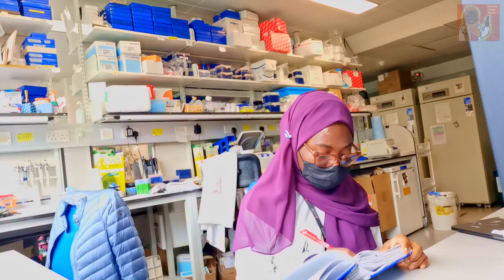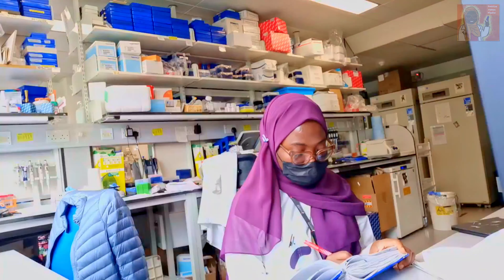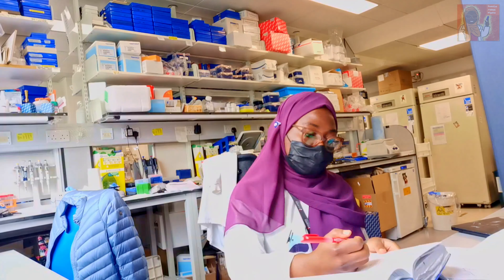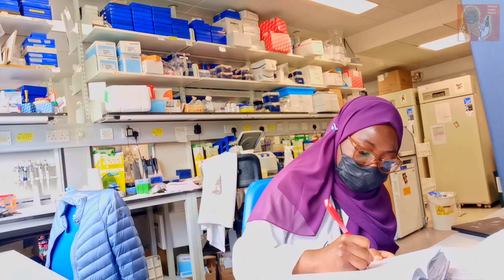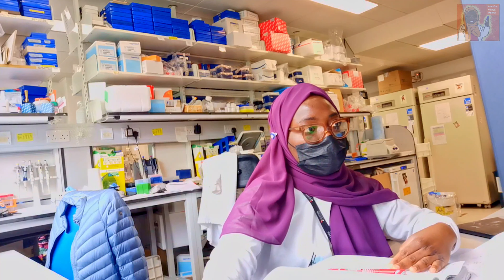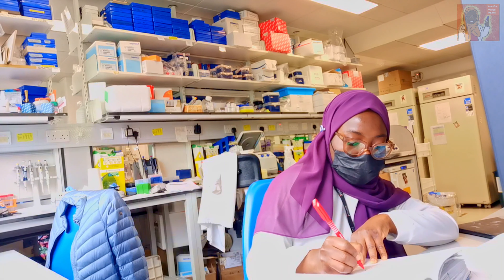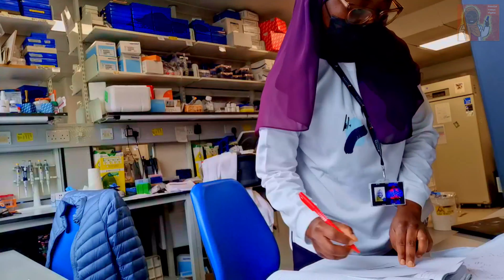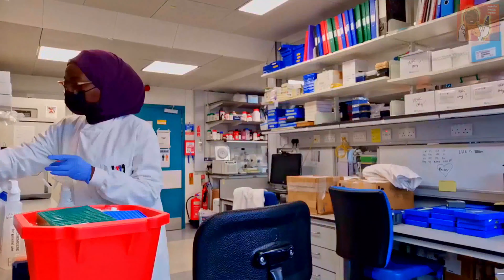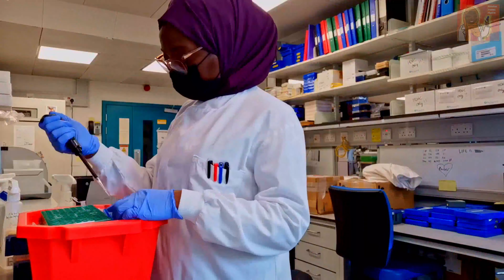On Sunday I mentioned that I had run the second batch, so this is Monday. What I did on Monday was first try to update my lab notes with all of the results from my past experiments, because I don't like to leave that for too long. So I spent the early part of the morning putting the gel images into my lab notes, and once I had finished I started my third batch of experiments.